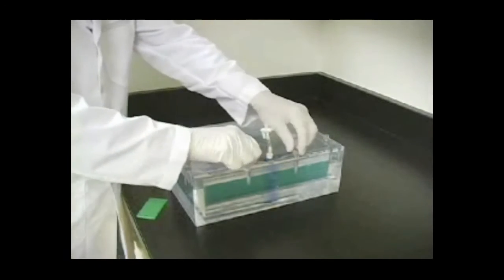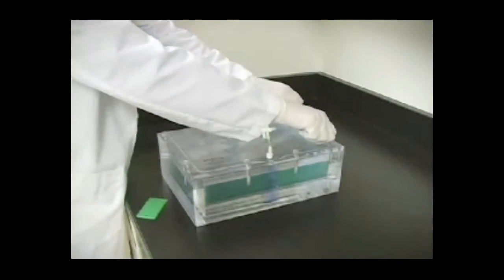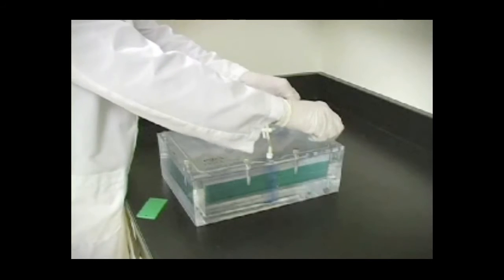Allow at least 2 hours for polymerization. After polymerization, remove the sealing plate from the multicasting chamber.